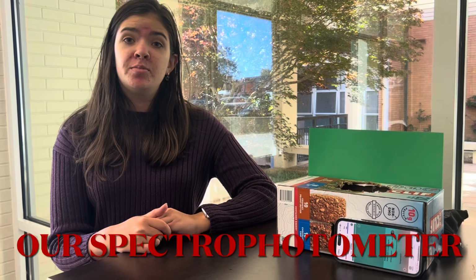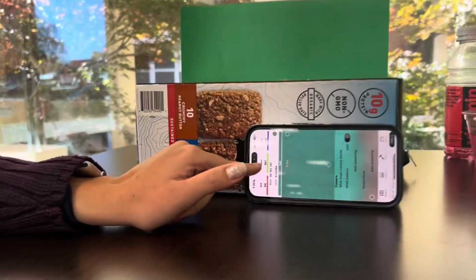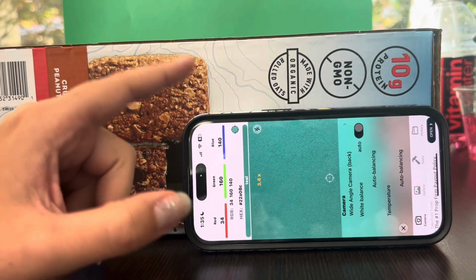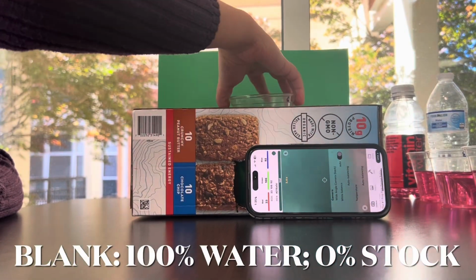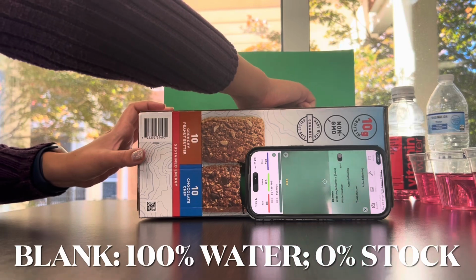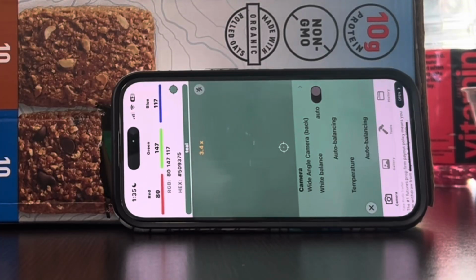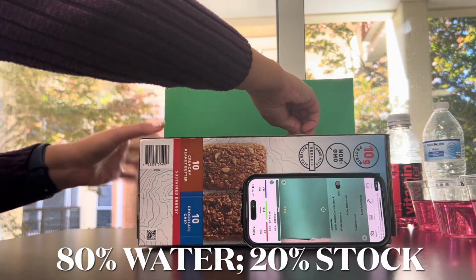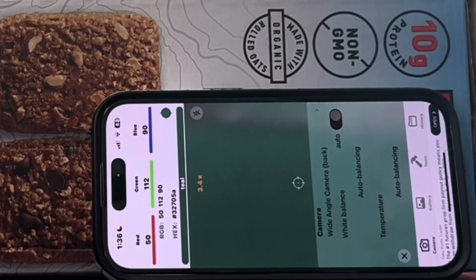So we're using the colorimeter app today, and we're just measuring at this number right here, how much green is passing through the spectrophotometer. Okay. So the water solution is just our blank. We'll blank between each to ensure accuracy. Okay, and that number right there is 147. We'll do the 20%. And that number is 112.